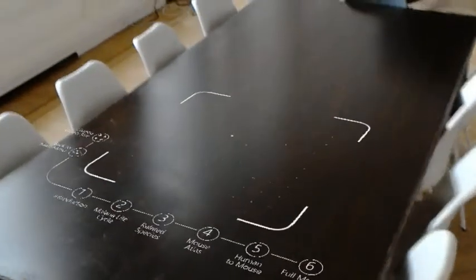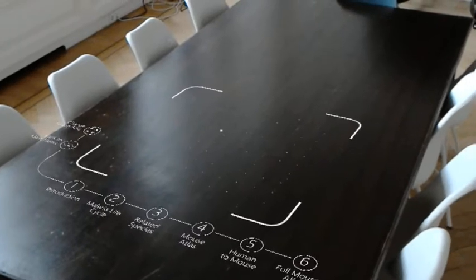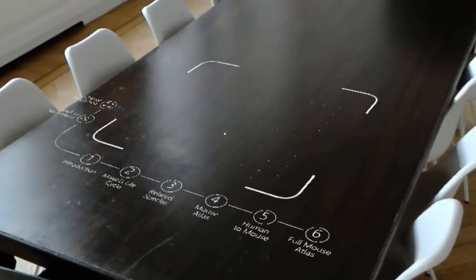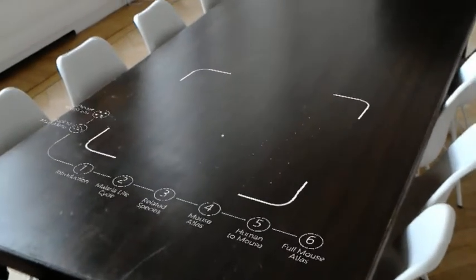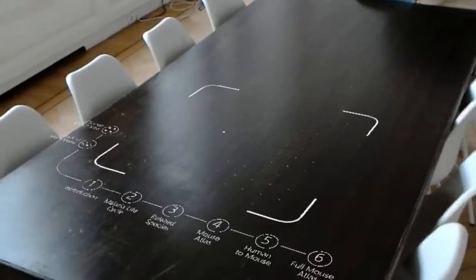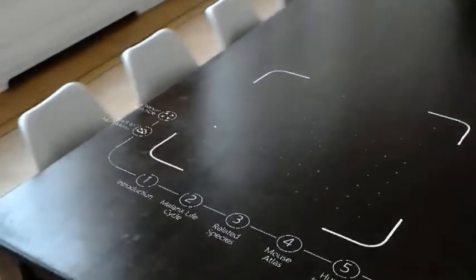So the purpose of this HoloLens app is to visualize complex genomics data from the Wellcome Sanger Institute. And the way we do it is there are 6 steps, and each step will guide us through the research in such a way that after roughly a couple of minutes, you'll get an intuition or an idea about what this research is about. And it starts with the first step.